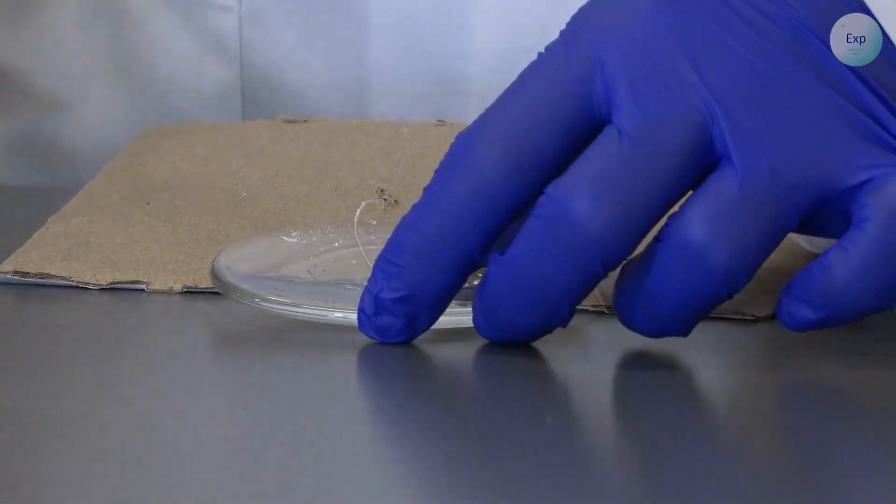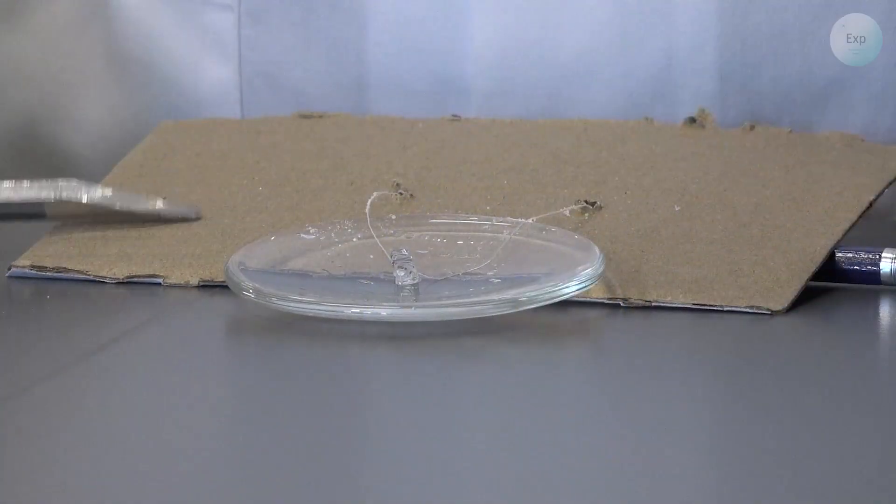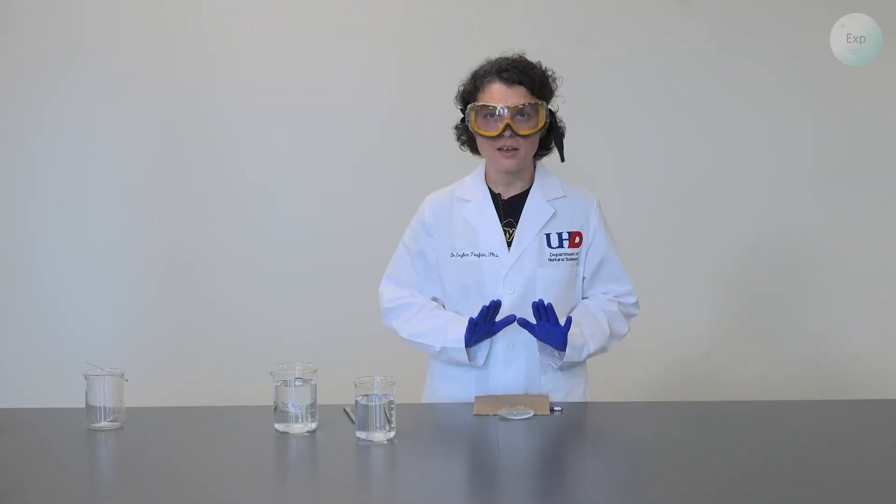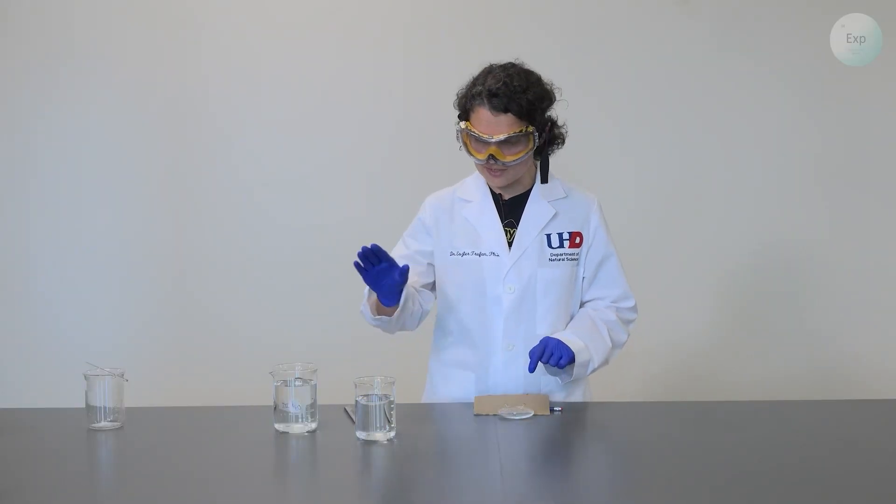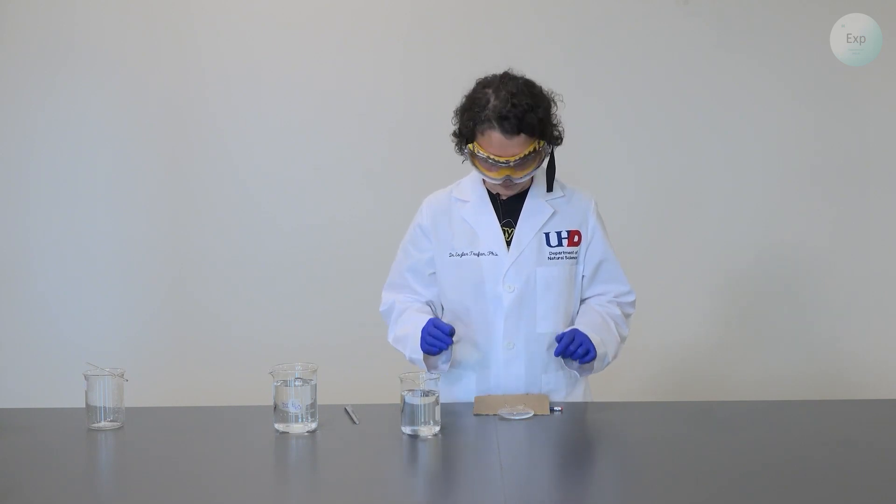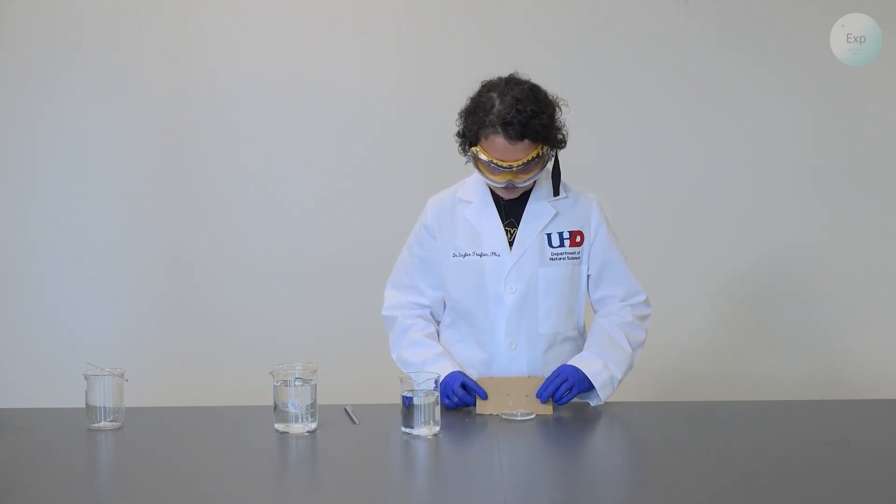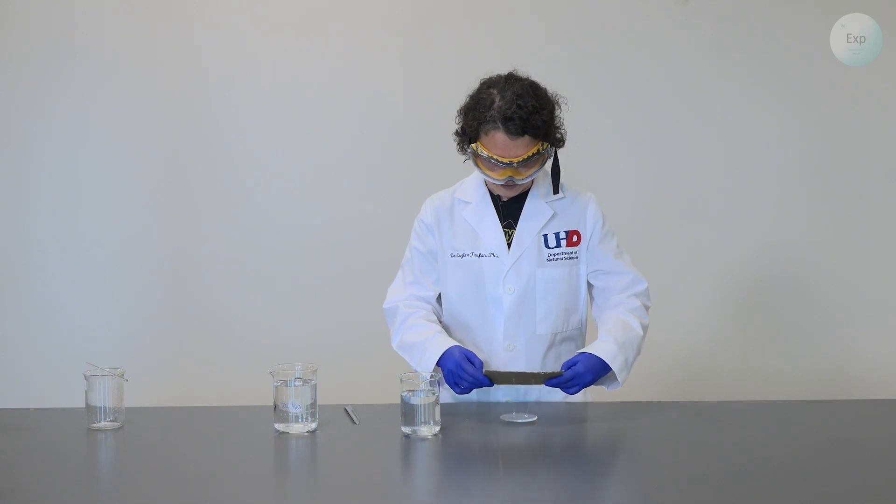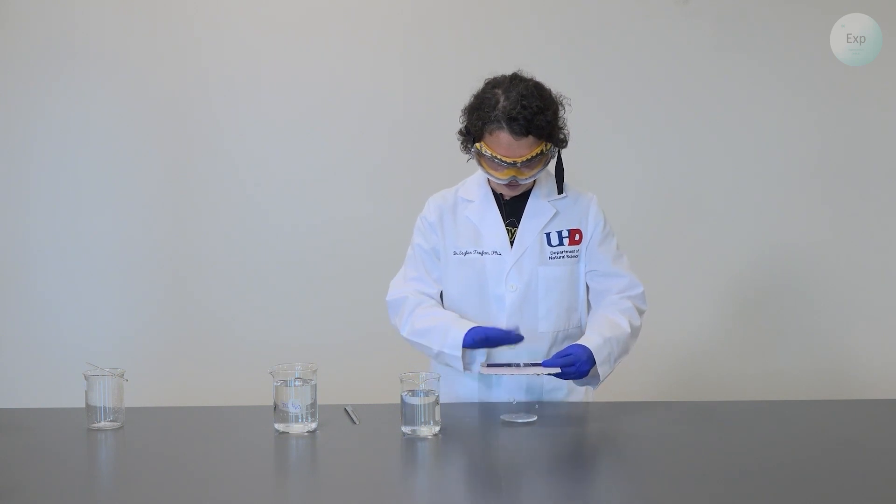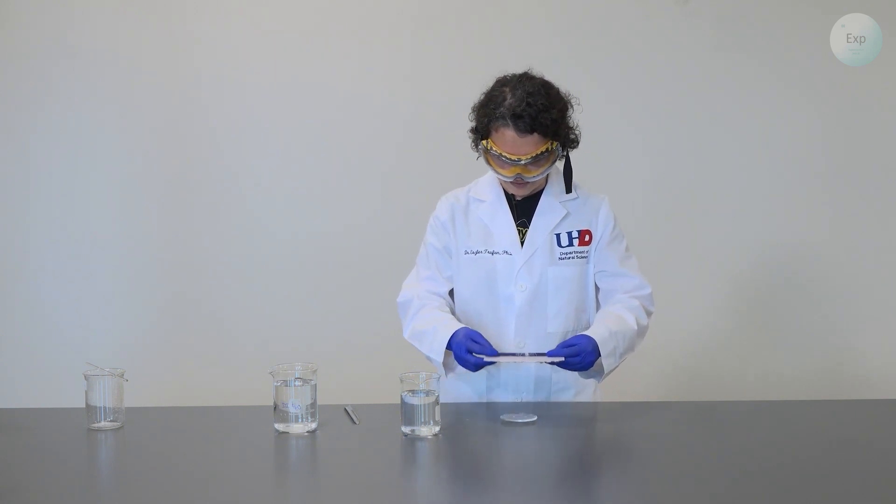And with that, all the excess crystals have been removed both from the solution and the thread. And now if we place these two crystals inside our grow solution, these will be the only two that will grow. So I will pick up my cardboard top with my pencil.